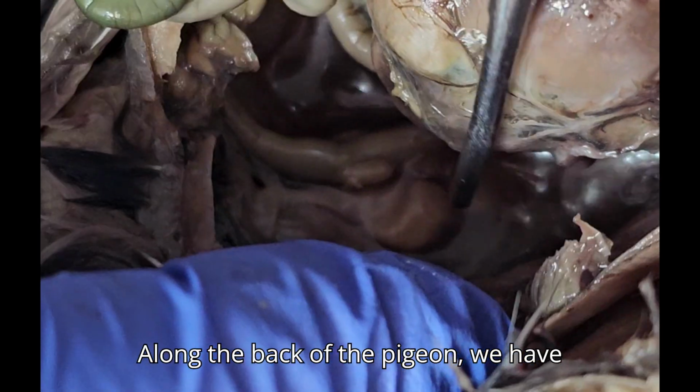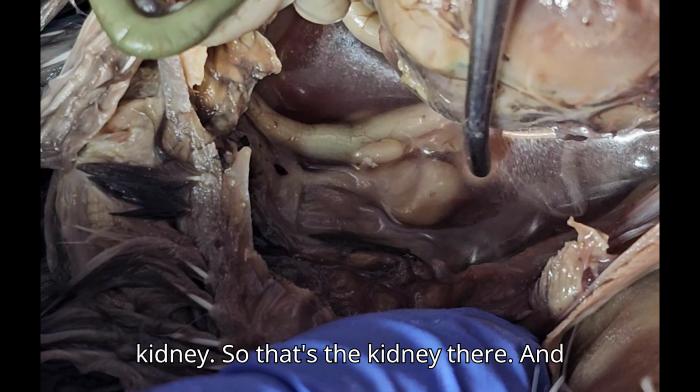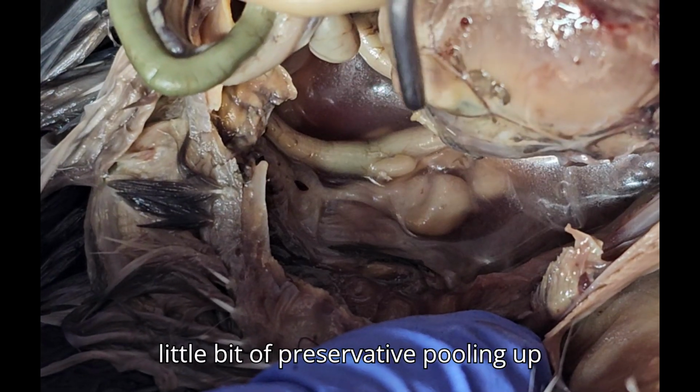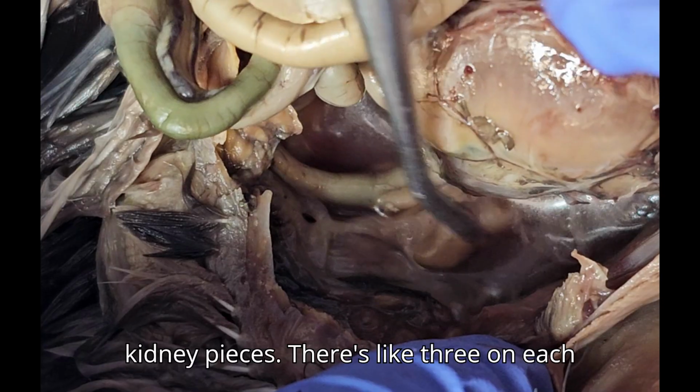Along the back of the pigeon, we have little lobes, or little pieces of kidney. So that's kidney there. And there was a membrane in front. The membrane that was in front of the kidney was the parietal peritoneum. You can see a little bit of preservative pooling up back there, but you can still see the kidney pieces. There are about three on each side.